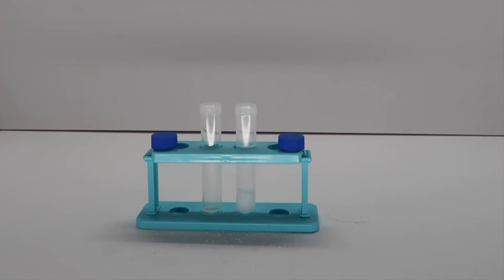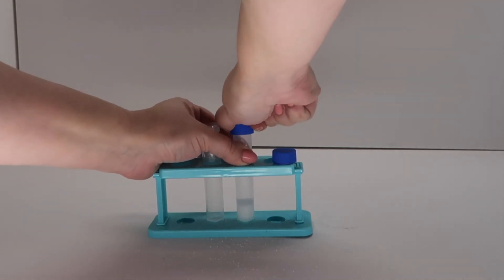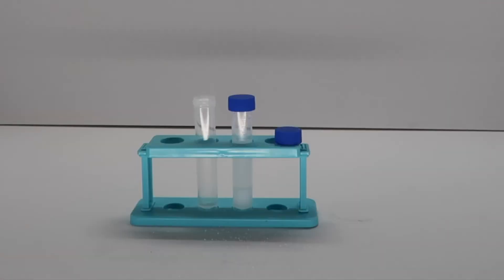Next, you're going to put the lid back on and shake the test tube to dissolve the borax. Next, measure out 10 ml of water into the second test tube.